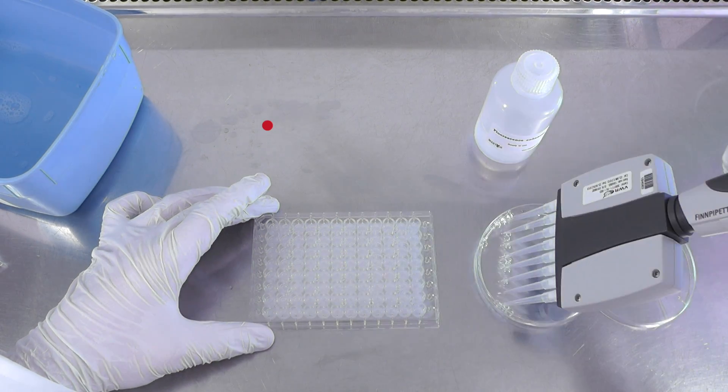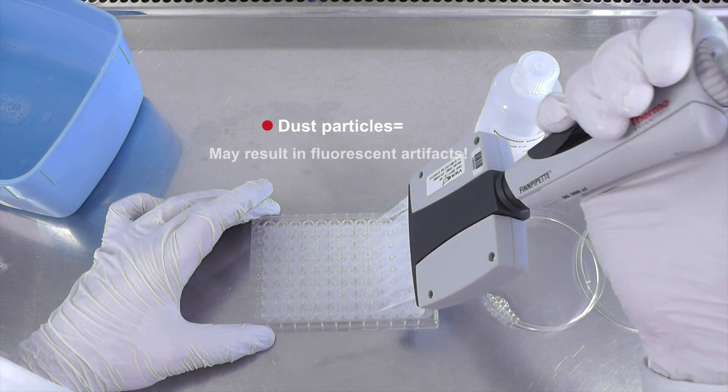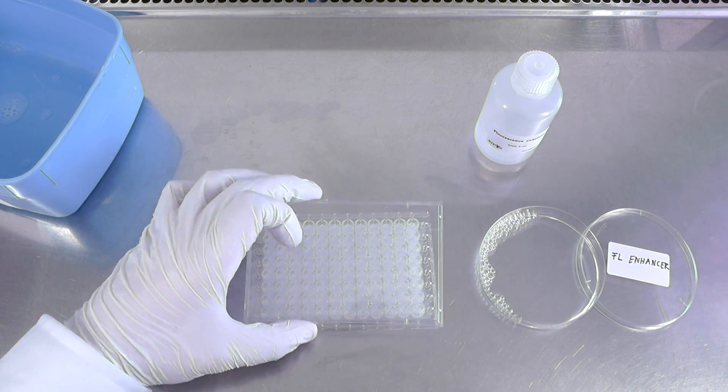In the case of a reused container, contaminating particles are often present and can become quite problematic if mixed with fluorescence enhancer and then pipetted into the plate.